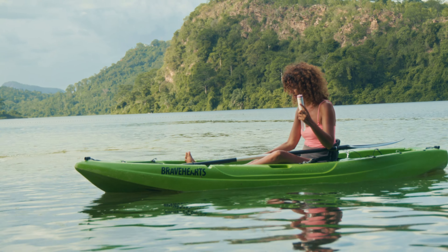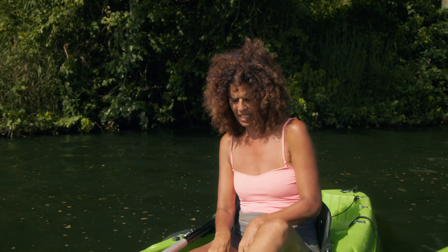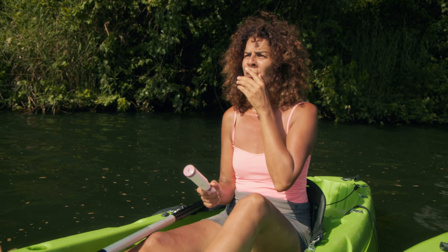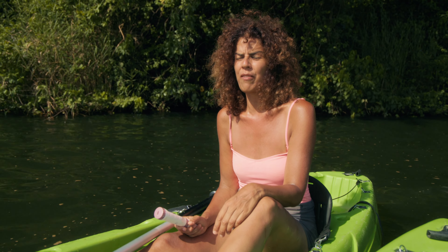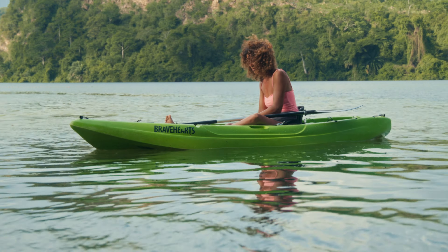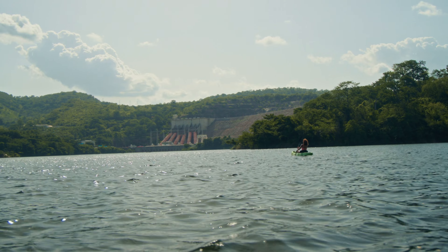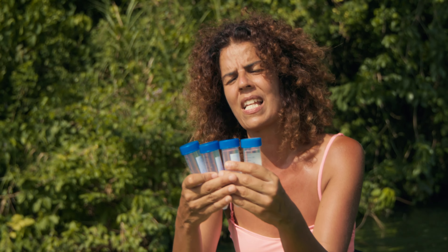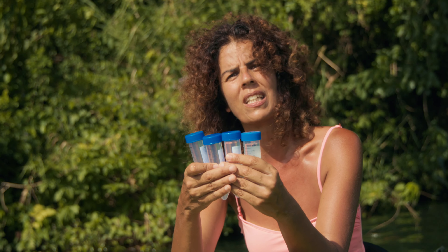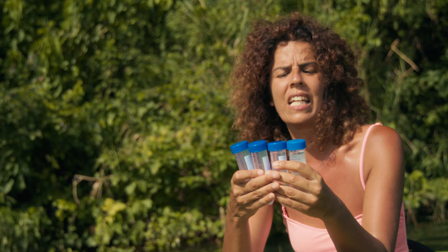My name is Isabel. I'm part of the Agbechi crew and my task is to collect water samples along the swim. We collect four samples at each sampling point and we have a tool that helps us collect some of the preliminary data that we need. This data goes into an app so we get a full picture of the water quality data along the way.